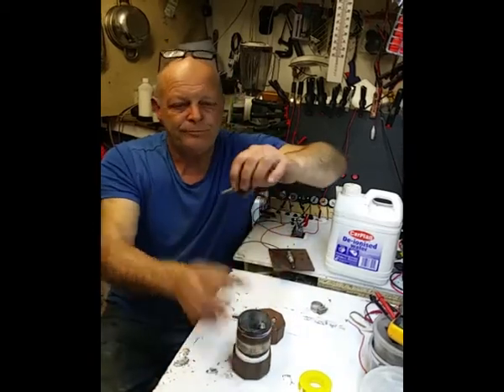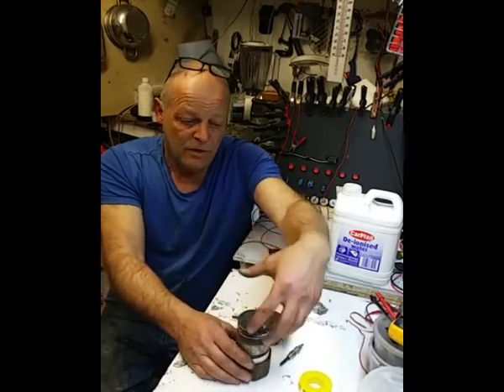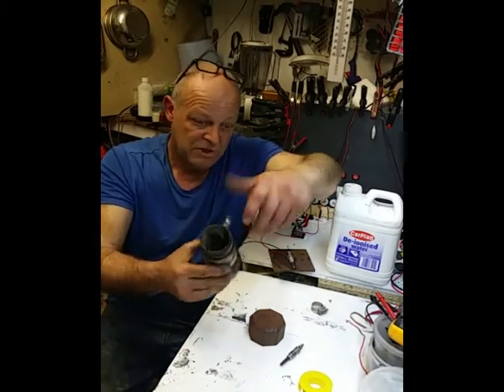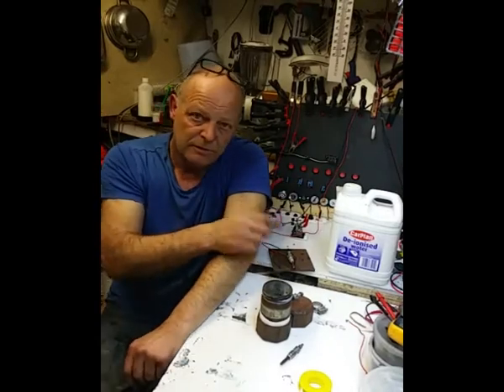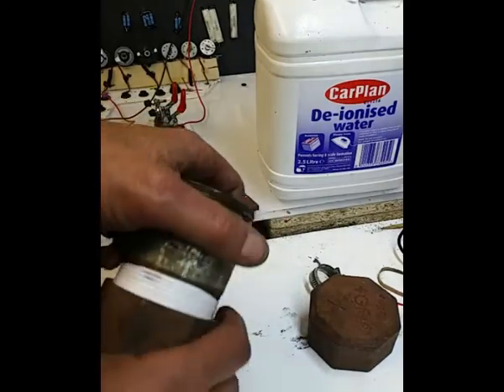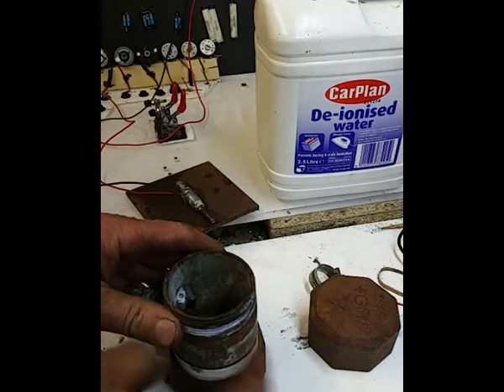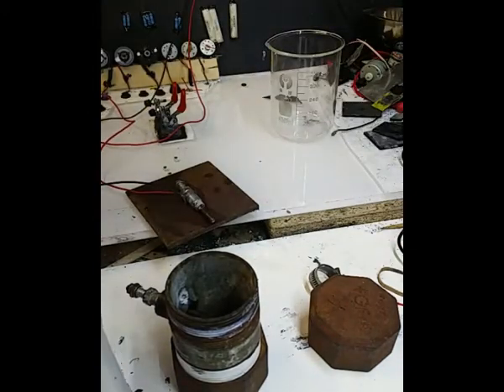So that's what I'm going to do, but first I just need to test it to see if it works and heats up the inside of this chamber. So I'll move the camera a bit closer and we'll fire this one up. Now just before we go any further, these pipe fittings are slightly larger than the ones RMS showed us. I don't actually know what the true capacity is of this, but I'm about to find out.